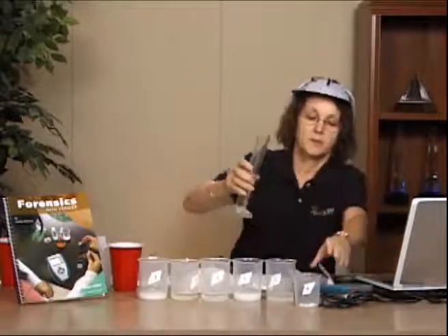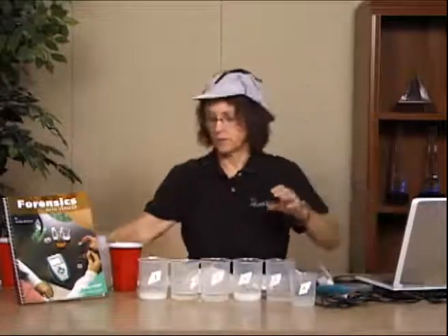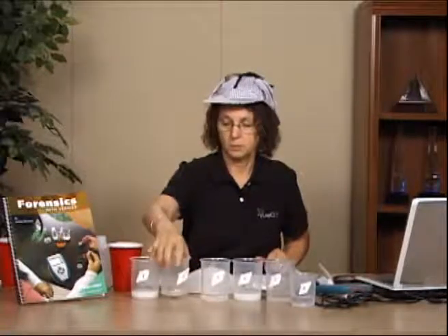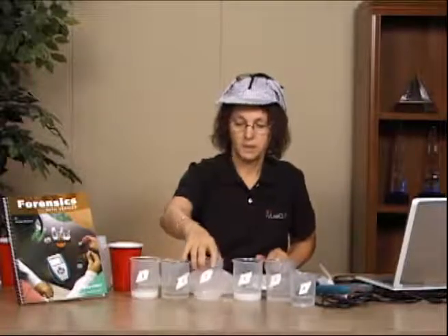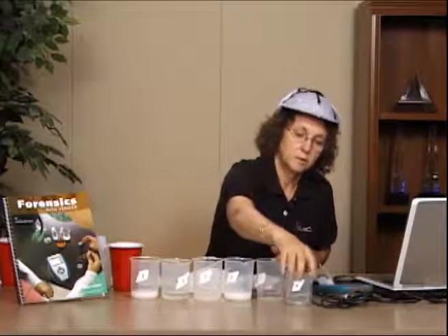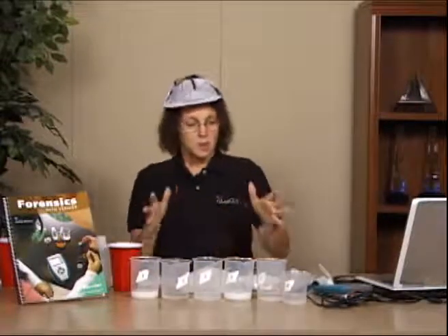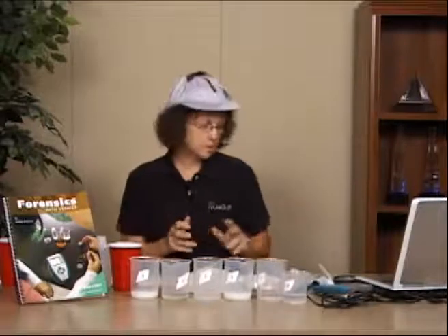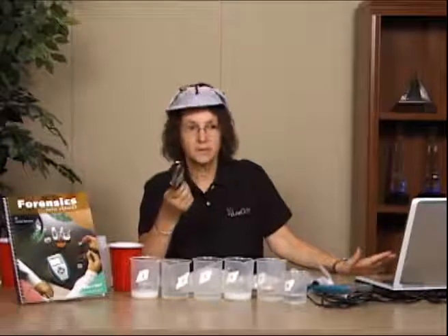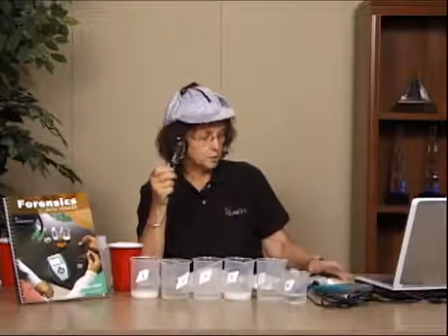So I've got 50 milliliters of water in each of my beakers, and all my kids are going to do is every 3 minutes, for 15 minutes, swirl these beakers. And again, I now have this downtime, but I do want them to be observing what happens in those containers. So while my kids are doing that, I suggest that we get out our magnifying glasses, and our magnifying glasses can be something like this that I buy in the dollar store, or they can be your magnifying glasses that you have for your biology sections or things like that.